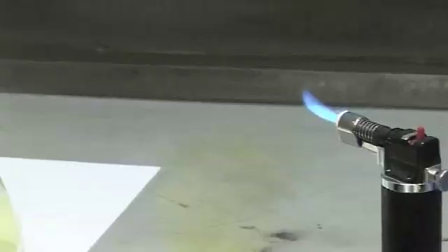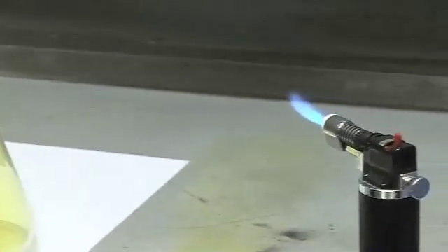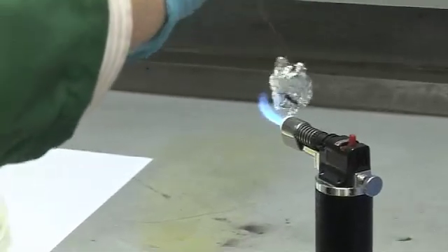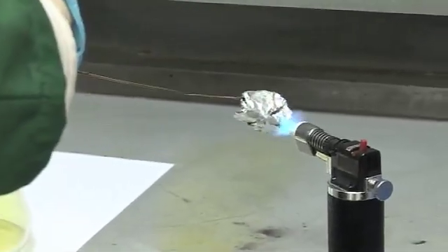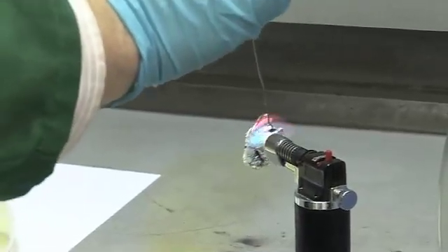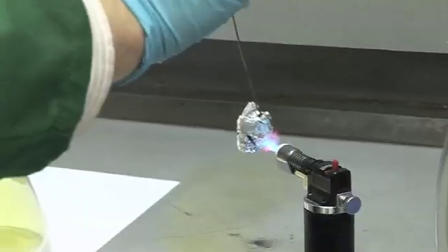So let's heat up our aluminium. Okay, so it's nice and warm all over. And then we'll add it into the chlorine flask.